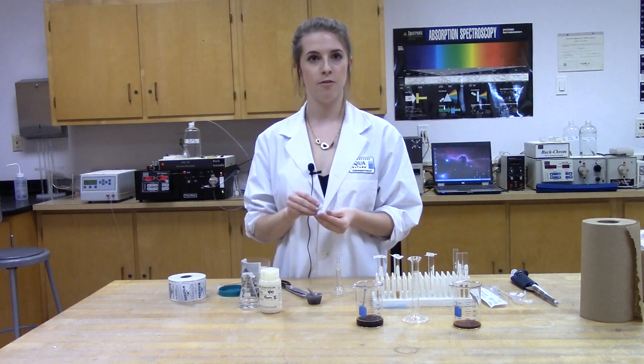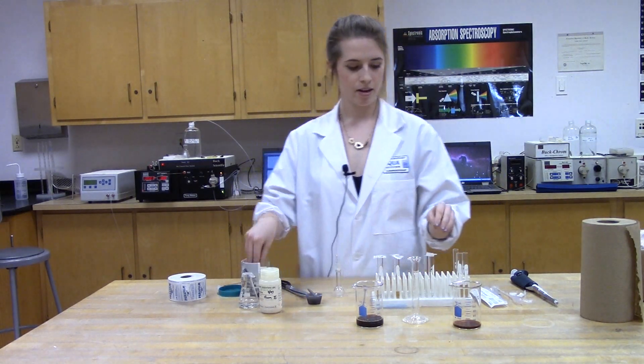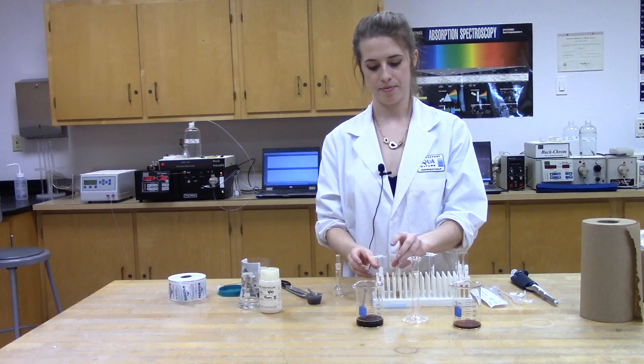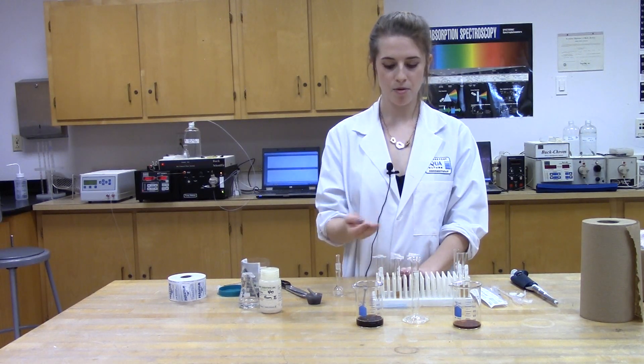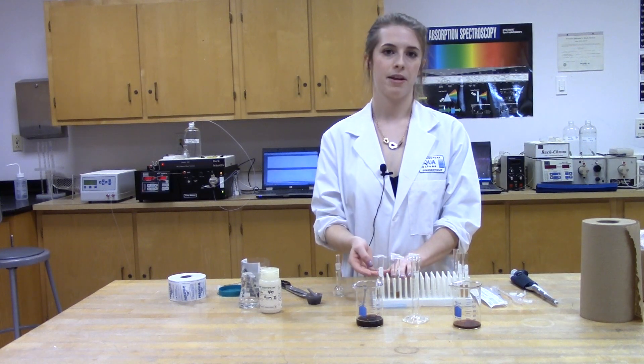Next, we repeat the procedure of filtering it through the filter pad and covering it quickly. After that, I have my pure sample of caffeine, and then my two samples of coffee.